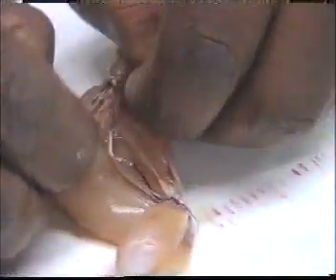We do blunt dissection to avoid damage to the nerve. We cut only when we are sure the nerve is clear.